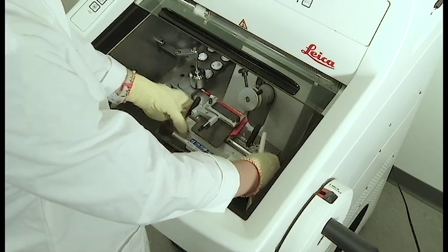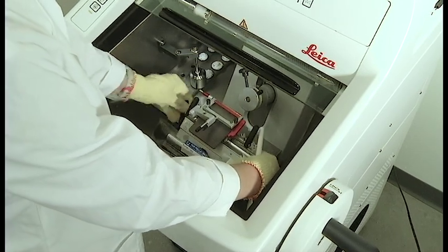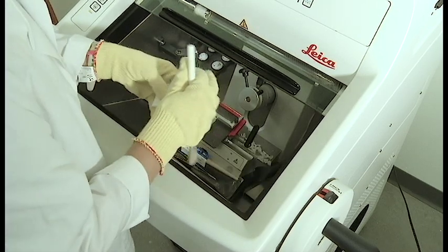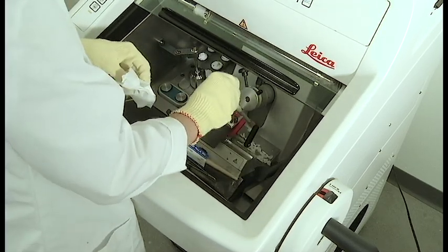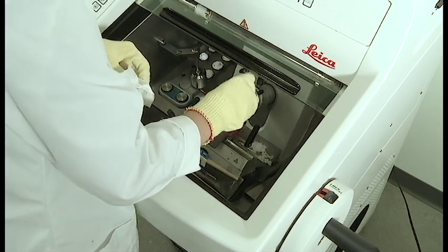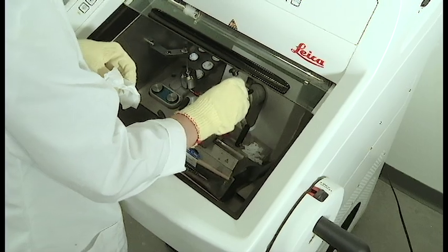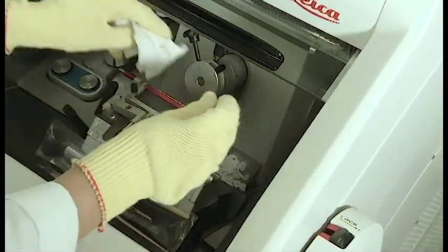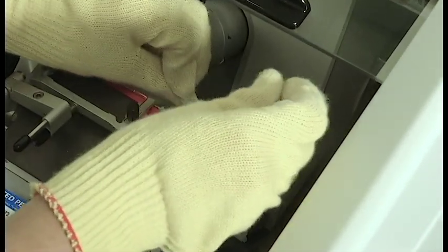When you have finished working on the cryostat for the day, you are going to need to get rid of the excess shavings that have gathered at the bottom of the cryostat. You will notice there is a basin specifically for this purpose. Use the brush to collect a pile of shavings, then pick up the entire pile using either a paper towel or a kimwipe.